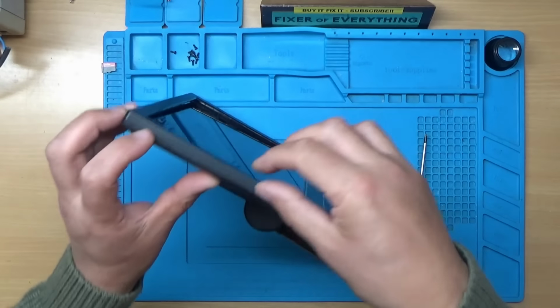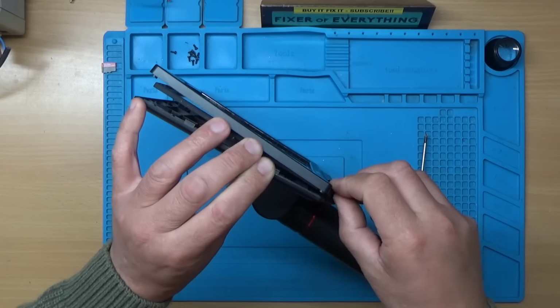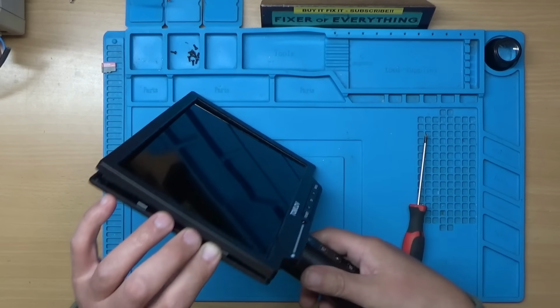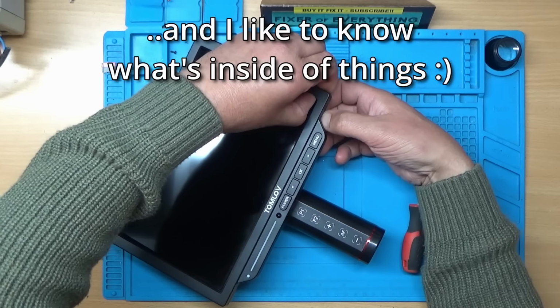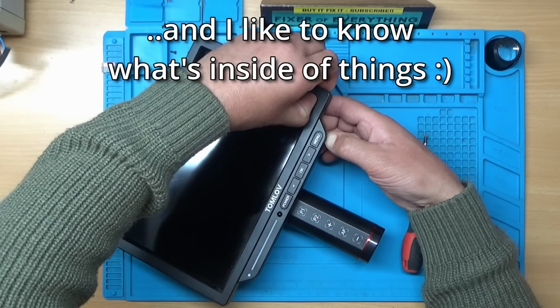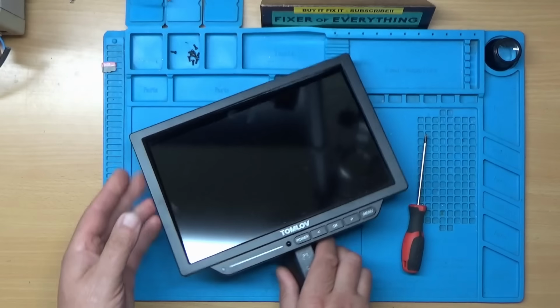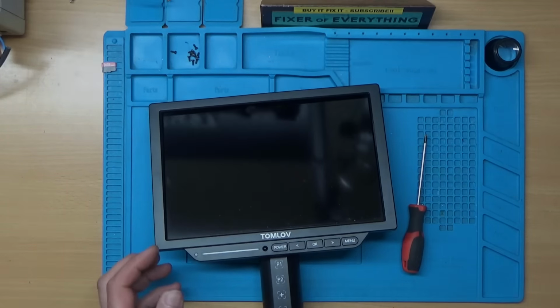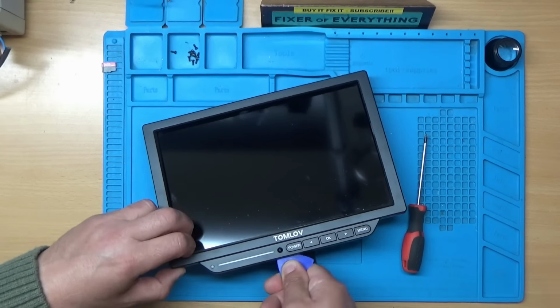Now I've actually been into this some time ago because I did try to add a microphone myself, but I was unsuccessful. But that was quite some time ago, so I can't quite remember how this came apart now. I should really find my little spudging tool. Right, I'm back with a spudging tool. Now, have I missed a screw under there? Yes.